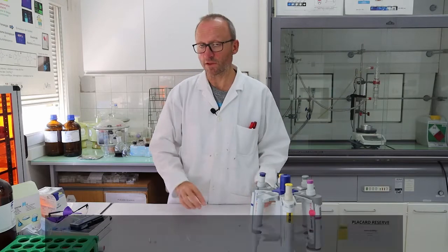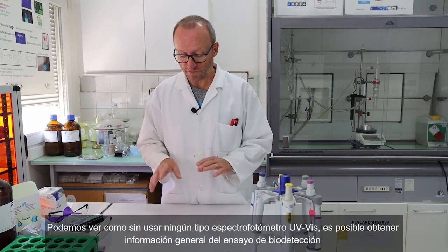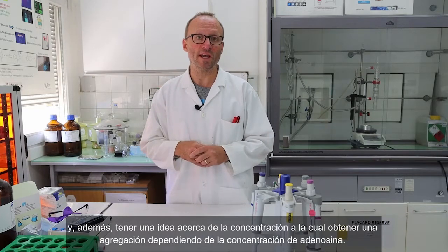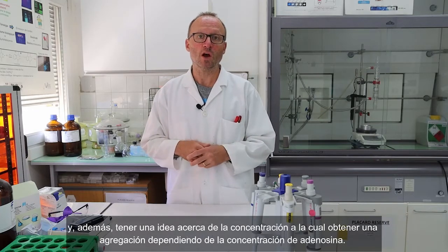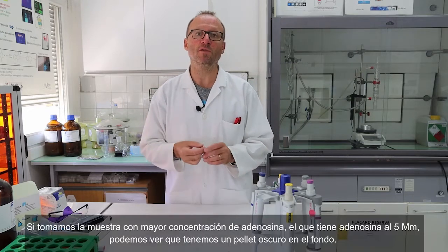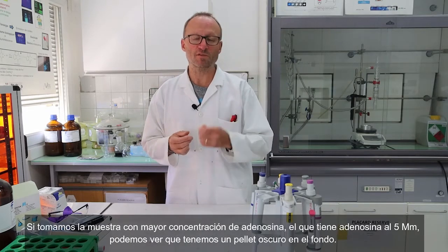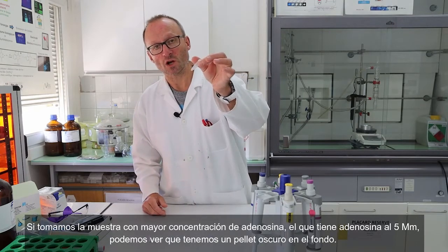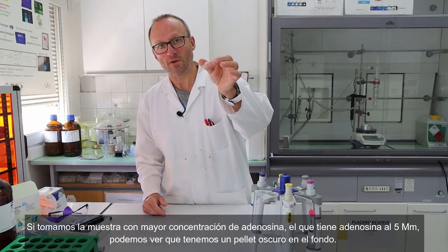So you can see that even though we do not use any UV visible spectrophotometer, we can have an overview of the assay and get an idea about the concentration where we got the aggregation depending on the concentration of adenosine. If I take the highest concentration of adenosine, the one with 5 millimolar, so you can see that I have dark pellets at the bottom, okay?